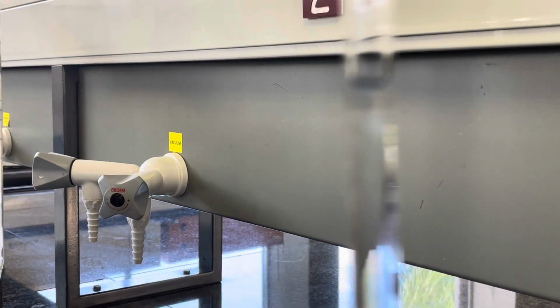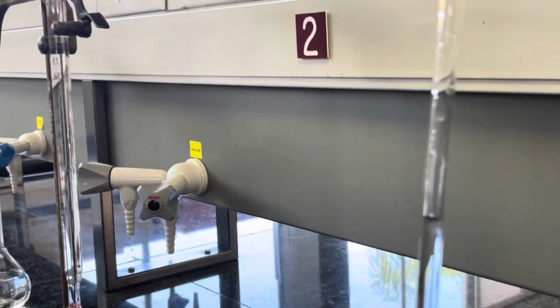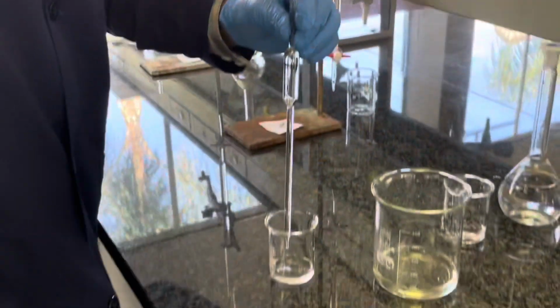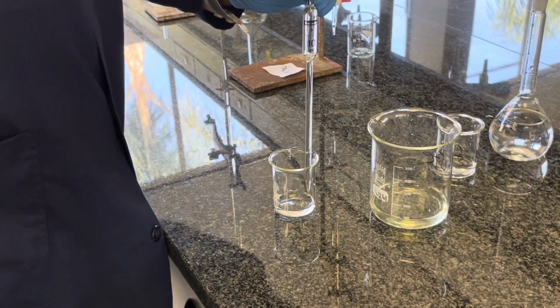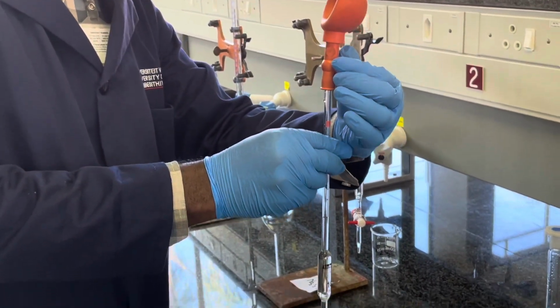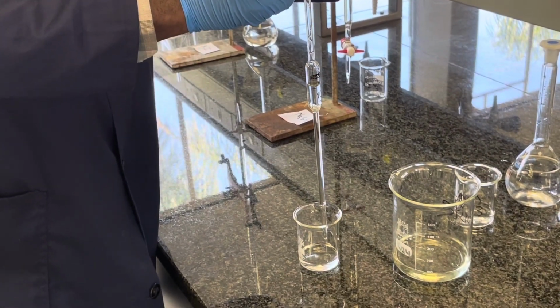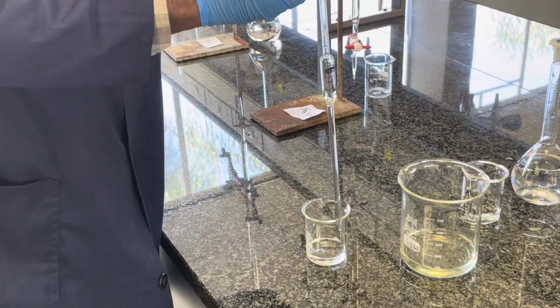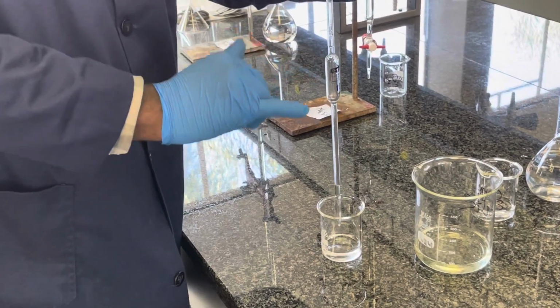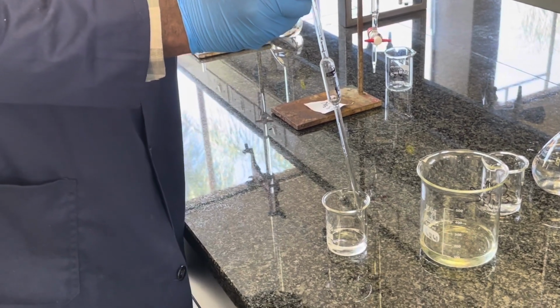There you can slightly see that line. It's a brown line, a very small thin line, which I tried to get in focus. I tried my best, and that's all that counts. Once you have an accurate volume, you dispense it by pressing the E button, eject, or completely removing the plush bulb. You add this to your beaker and your reaction mixture, whichever reaction mixture you are generating at this stage.